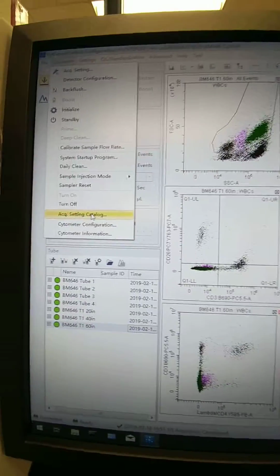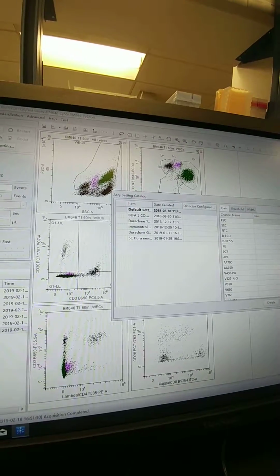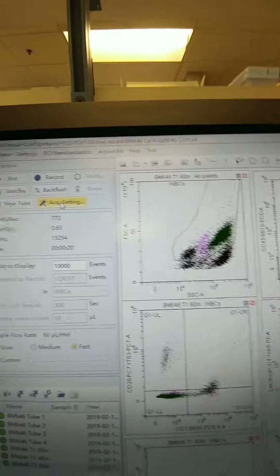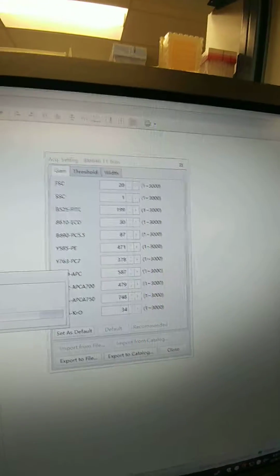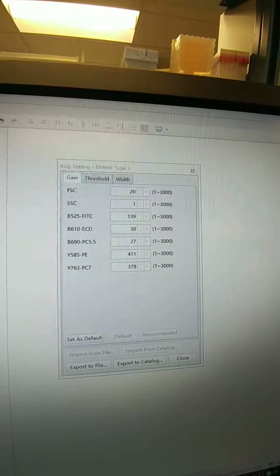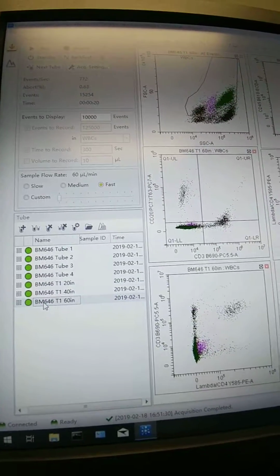Go over and click Acquisition Setting Catalog. Nope, that's not what I want to do. I want to open the Acquisition Settings menu. Okay, and here's what we ran that tube with. You can see as you click other tubes, those numbers change, right? So when you're saving the acquisitions, make sure you are collecting from the correct tube.